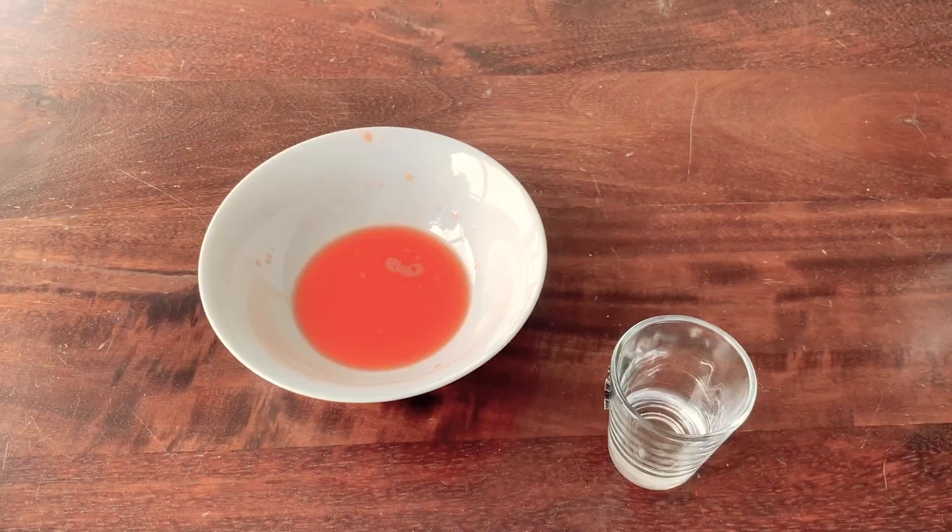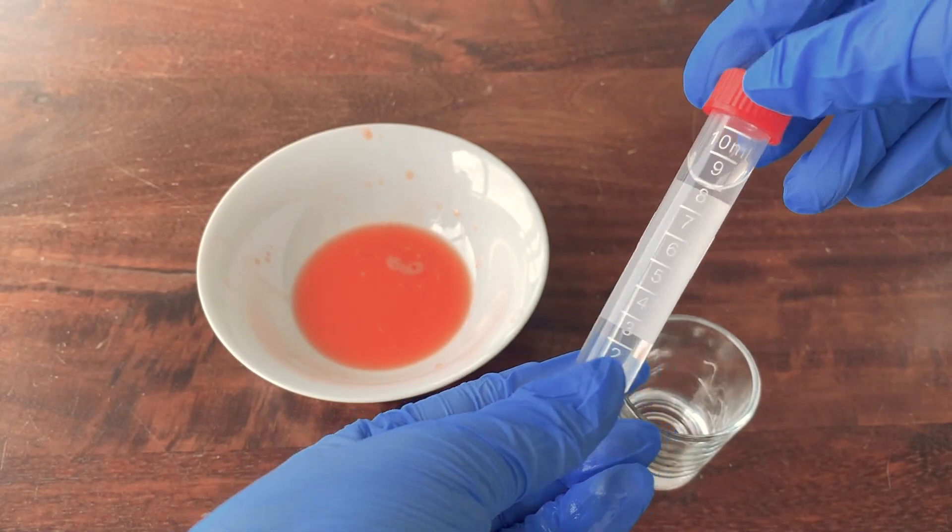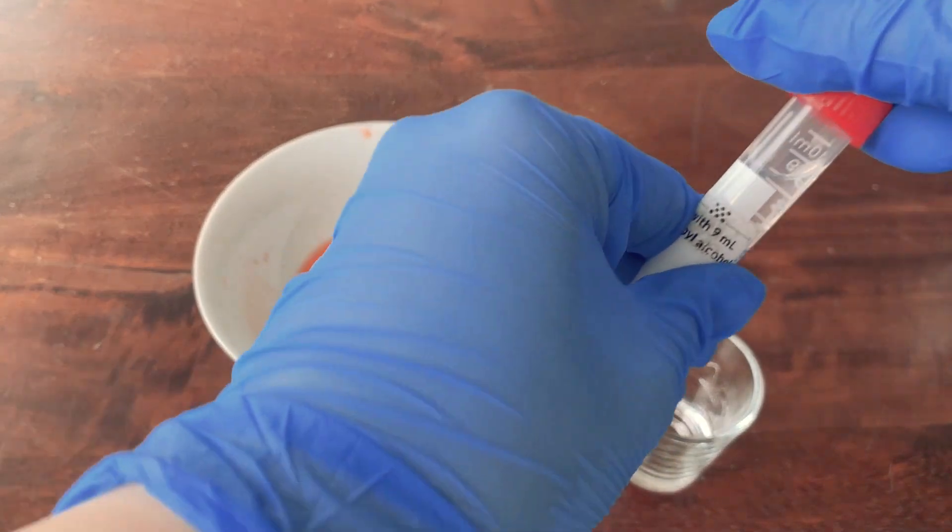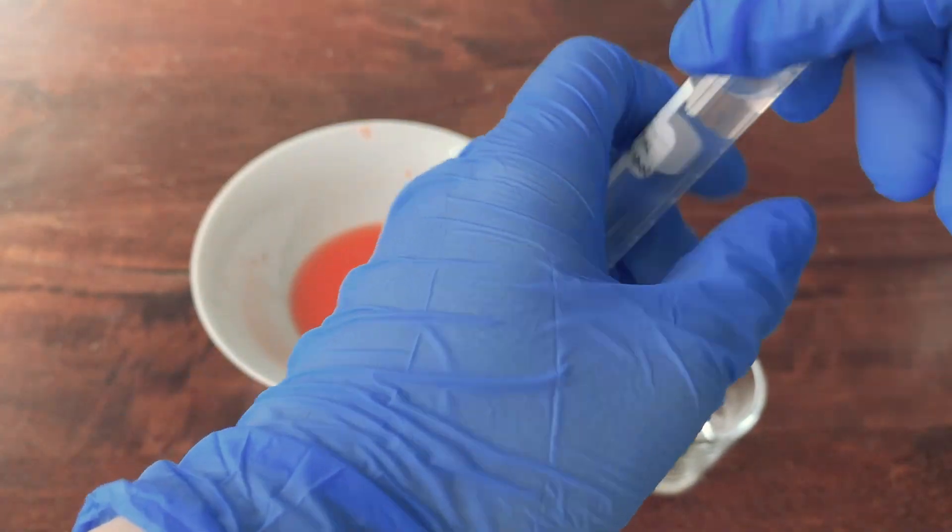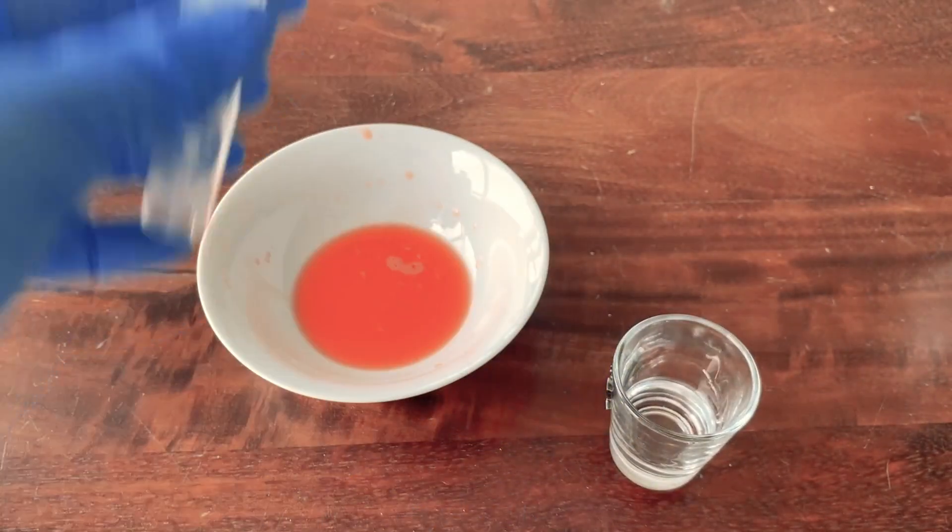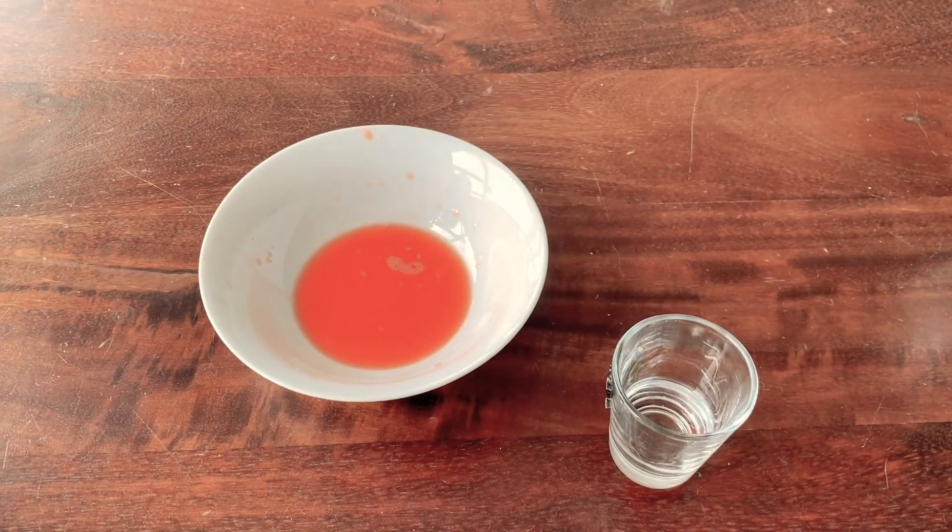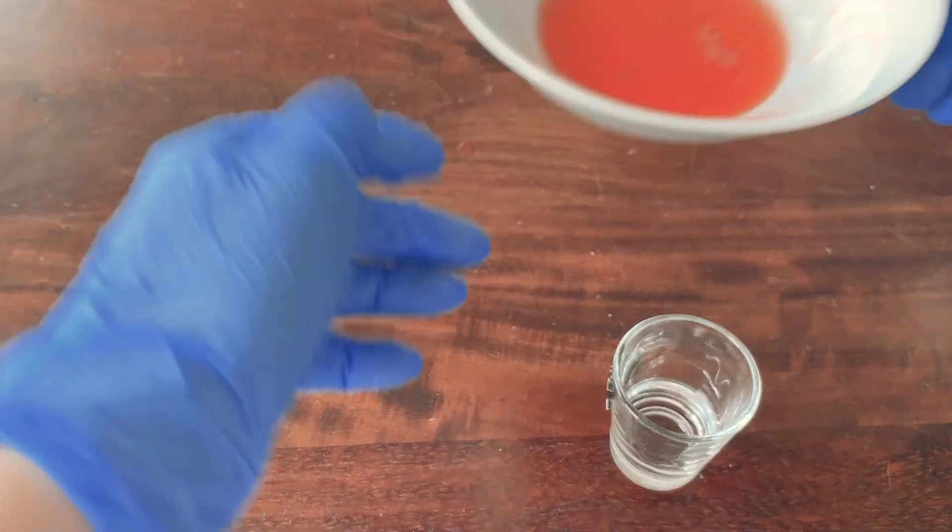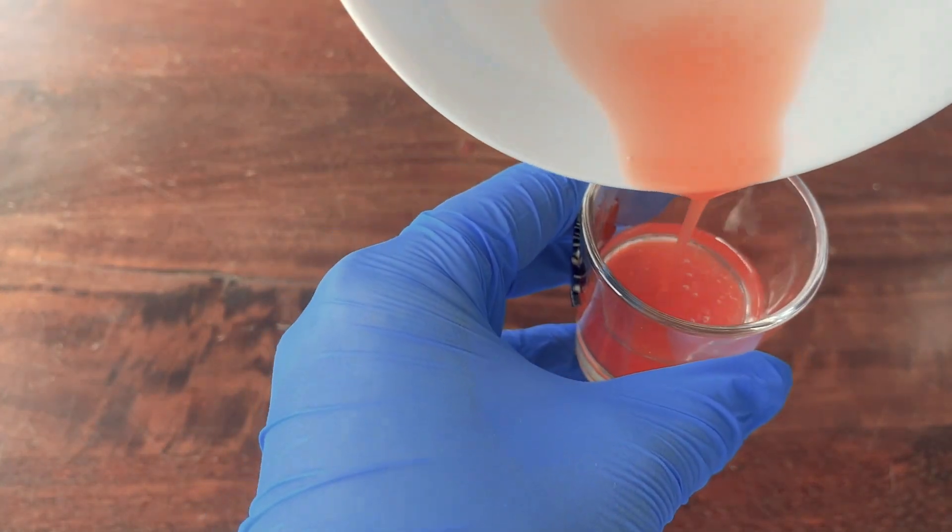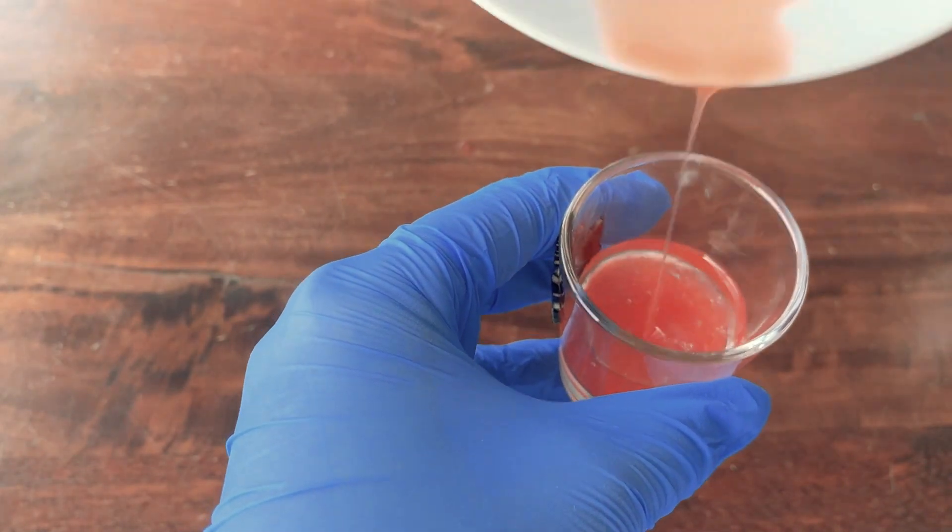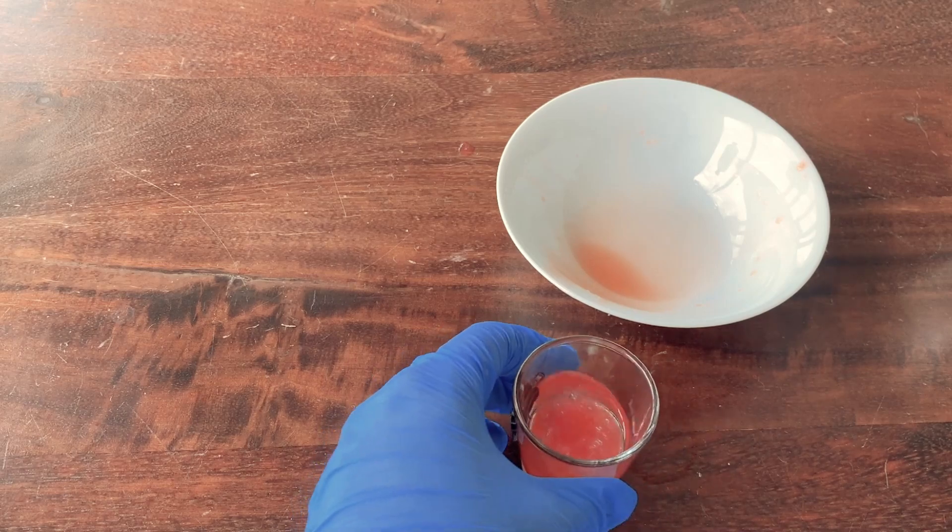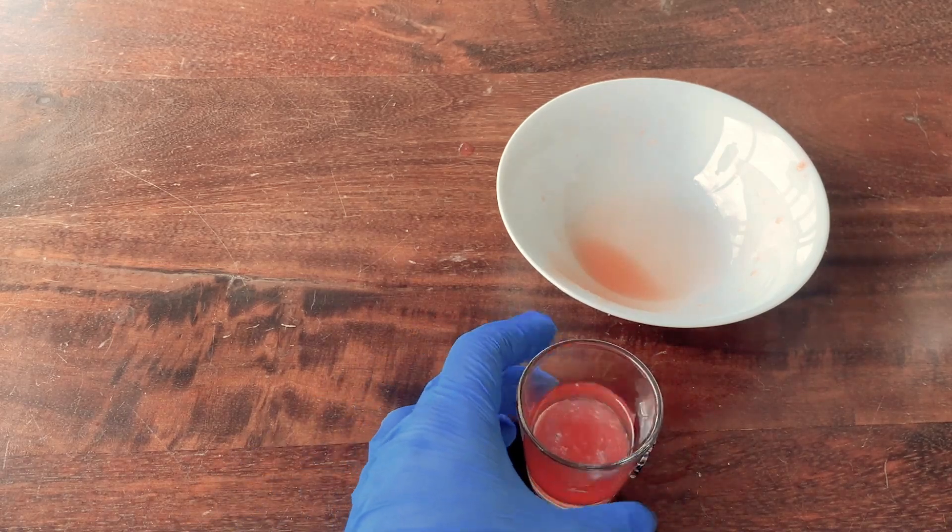We don't need this anymore. And now you have 99% isopropyl alcohol in the tube. And also don't smell the alcohol, it's not good for your lungs. So you can open it and pour it into the shot glass. And throw it away. So now, let's see. Carefully pour this. Mix it a little bit and wait a couple of minutes.